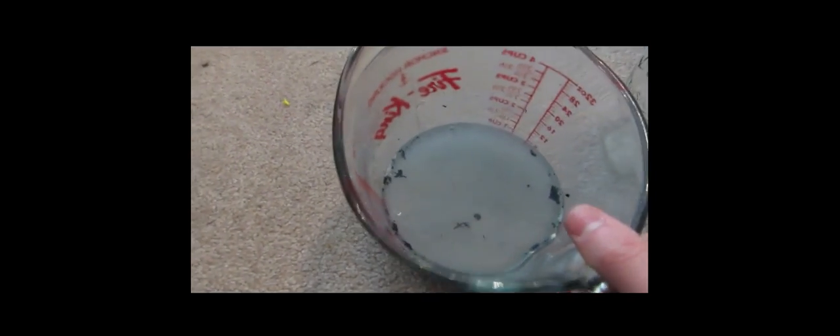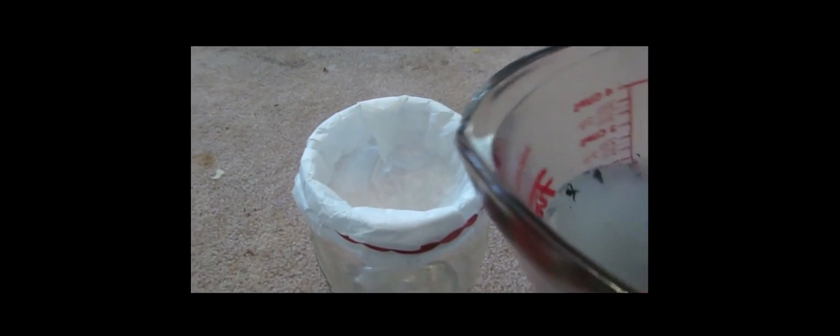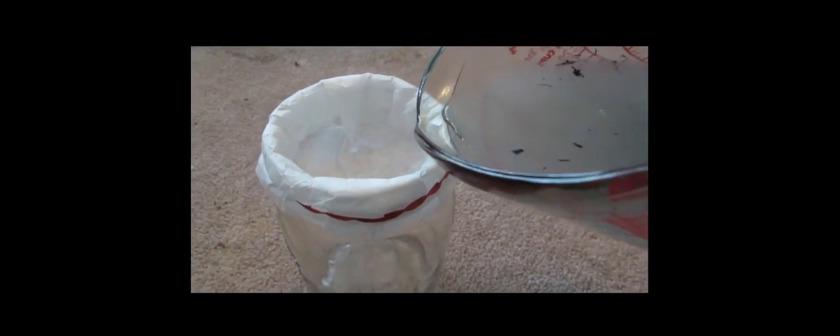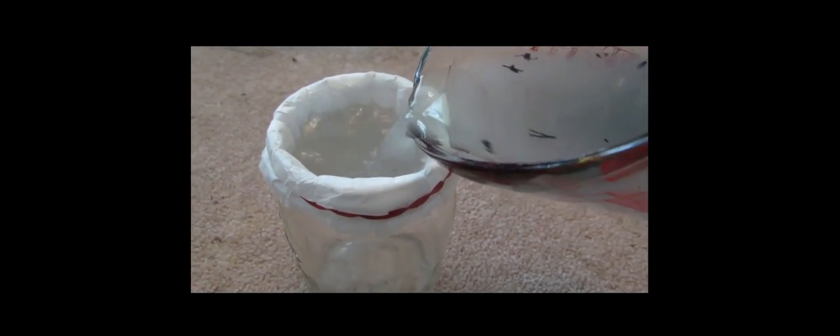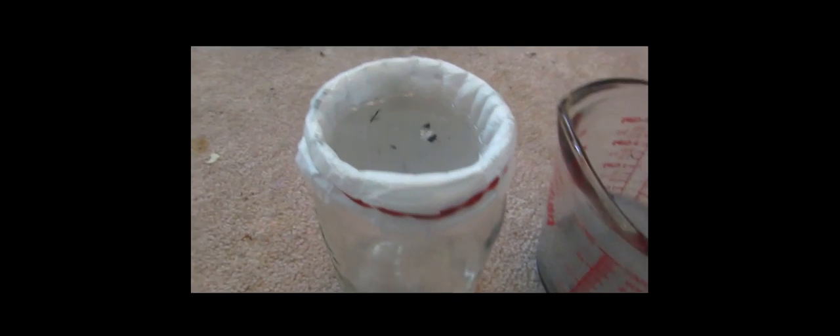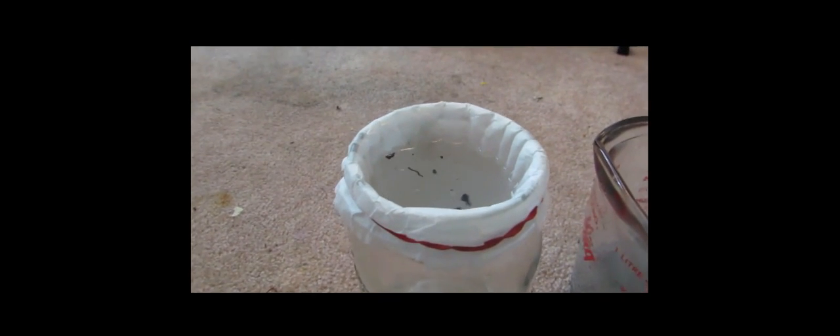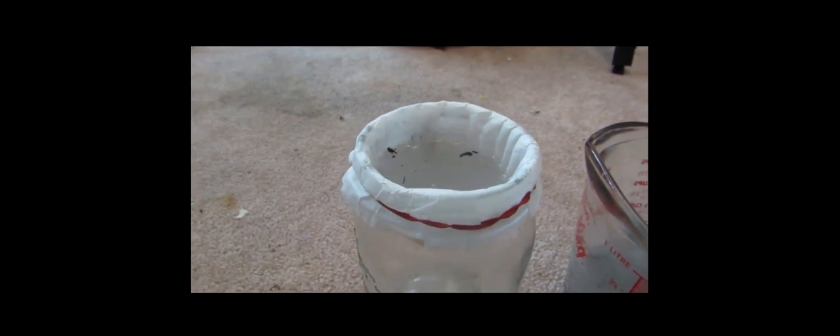Okay, so it has probably been half an hour or so and these ashes have soaked pretty well I'd say. So there might still be some potassium iodide that not get soaked up so we will save the ashes. But next, we have to filter it off. So we just have this canning jar with a nice filter.